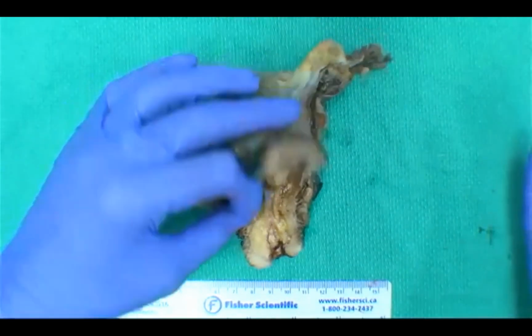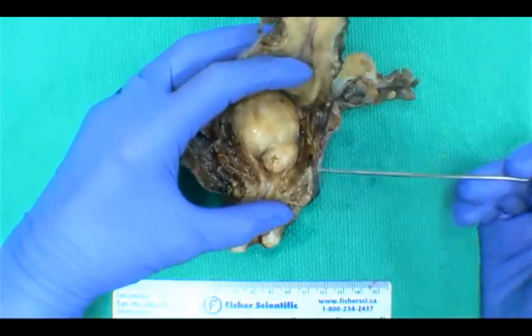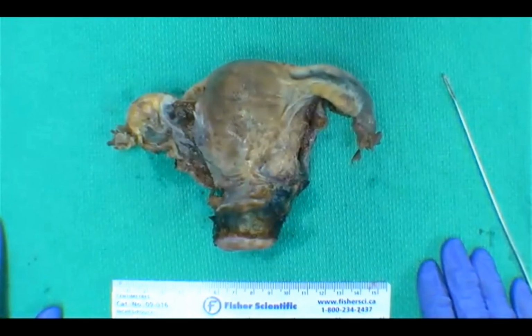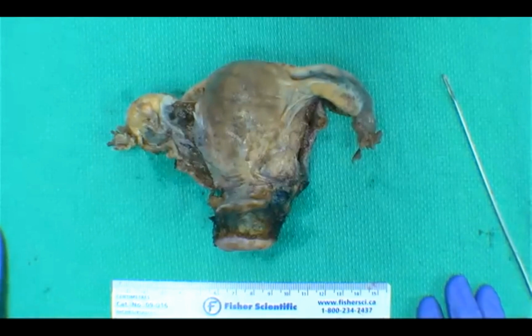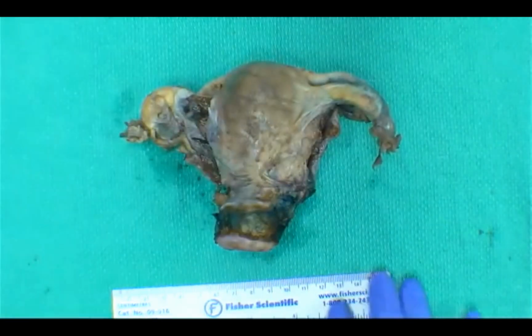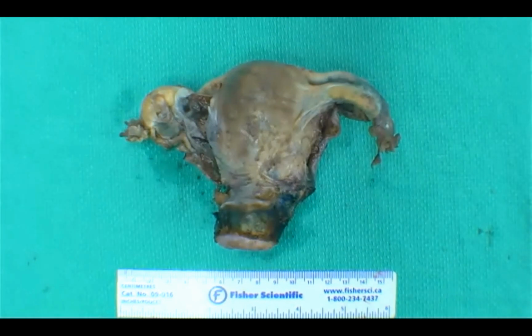And so once we have all those measurements, we'll start by serially sectioning through both halves of our uterus here. And then once we've sectioned through it, we're able to give a thickness of both the endometrium and the myometrium. Yes, and weight, of course. You can never forget the weights. So at our institution here, we weigh all our uteri fresh. Does anyone weigh their uteri fixed at their institutions? Always. So you can see there's always a lot of variation of when we get our weight, but weight is always very important. Oh, and some don't weigh. Very interesting. Okay, so we'll approach this specimen as if we're doing a cervical cancer.